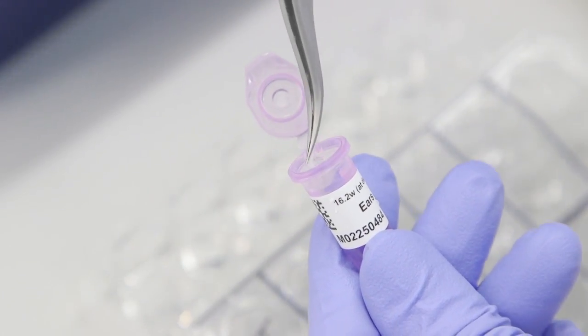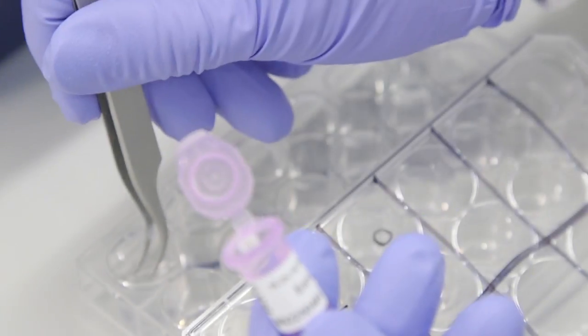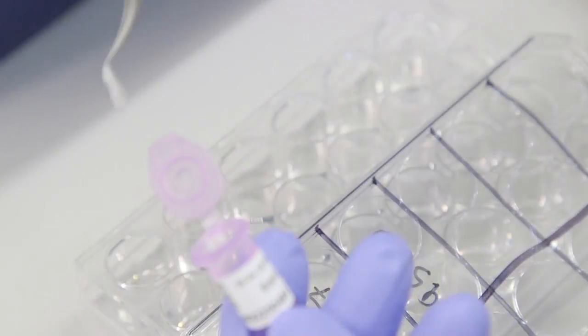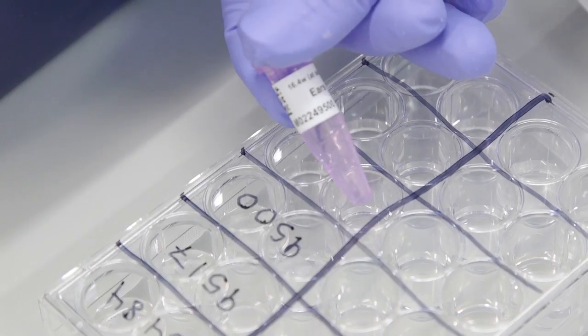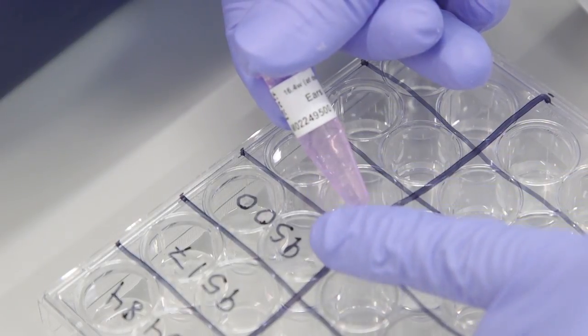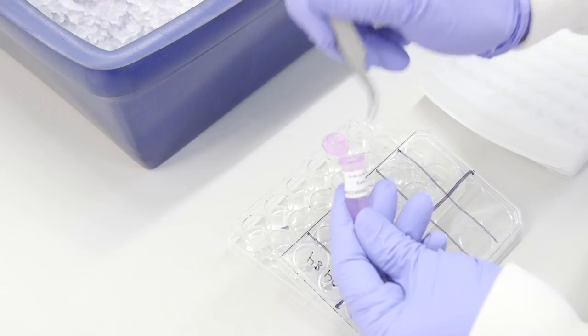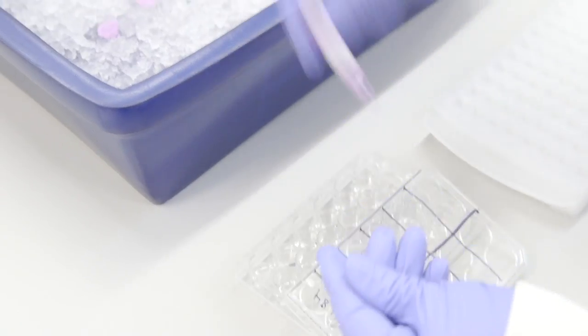Check that the ID on the tube matches the ID on the wells you are taking the sheets from. Once all samples are transferred to the tubes, place them on ice for 20 minutes.